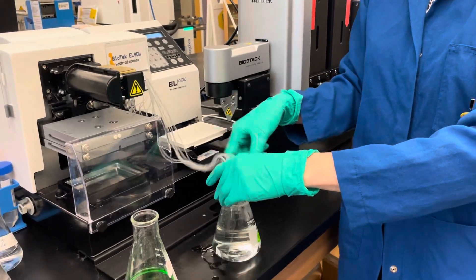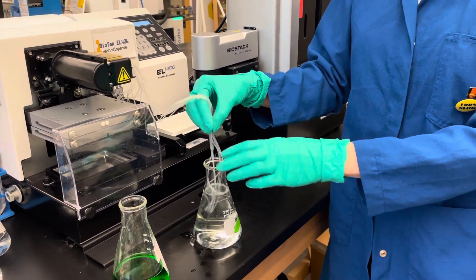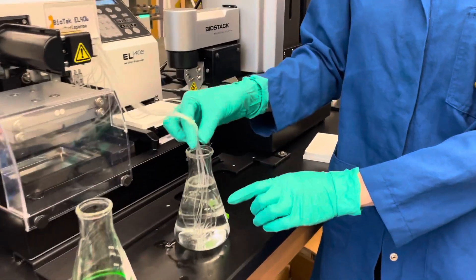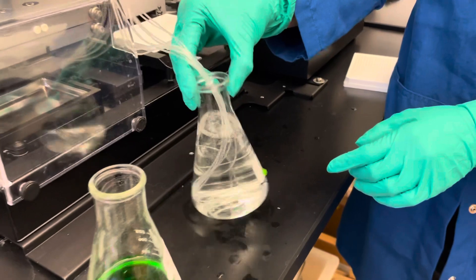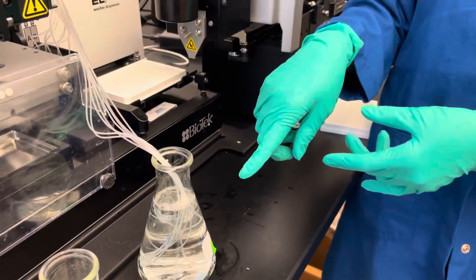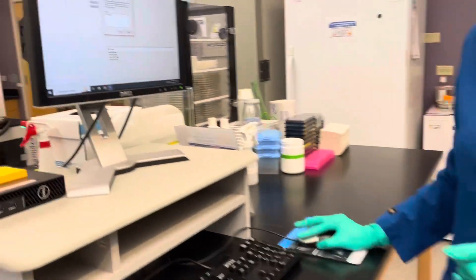For our protocol, we're going to be rinsing the tubes with soap and water to clean it before we're done. When you do that, make sure you get the outside of the tubes by shoving the tubes into the flask and actually making sure they all get wet and rinsed off. Because the priming is only going to clean the inside of the tubes, not the outside.